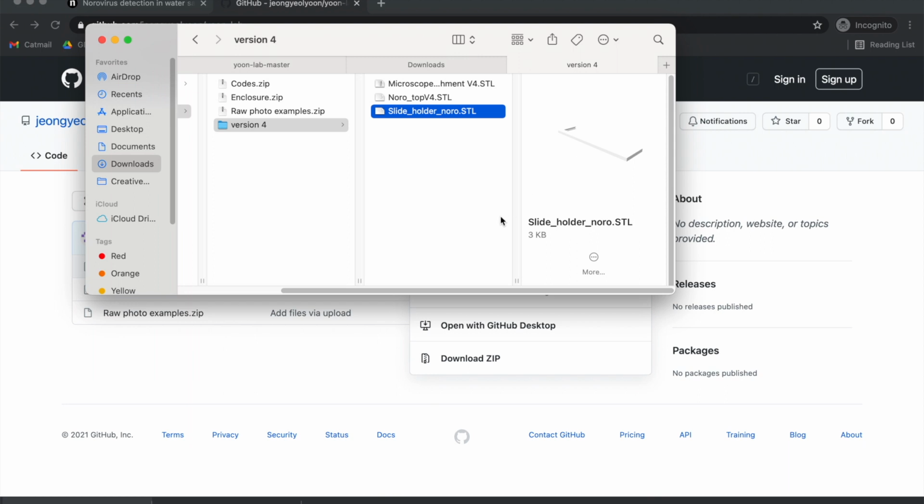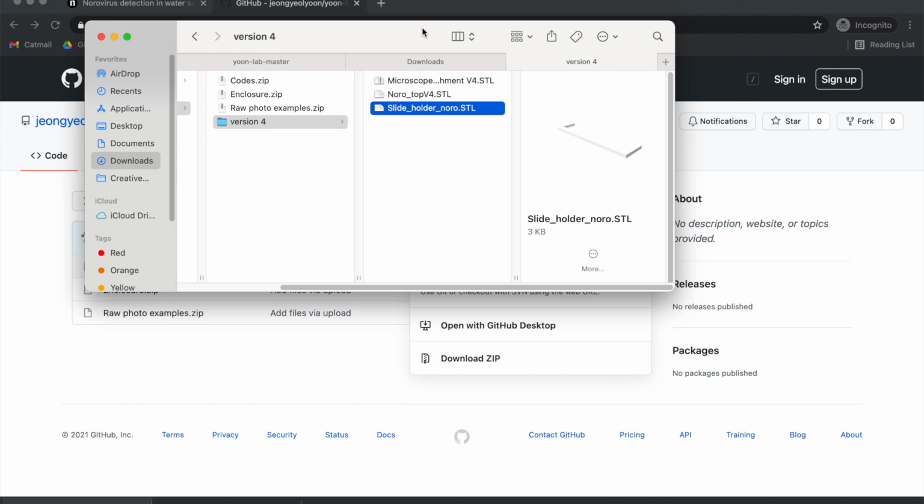So if you're going to be 3D printing this through an external party, then all you do is send them these files and then specify what type of filament you want to use. We just use PLA black. Color doesn't matter, except one of the points of this case is to eliminate ambient light sources, so I would recommend black.